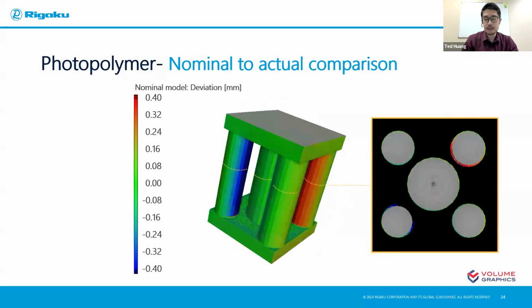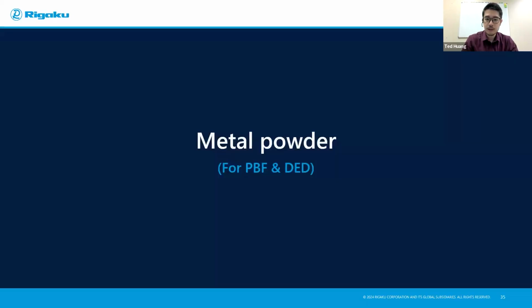So in this case, I learned about it because I did a nominal to actual comparison of the actual product I just made compared to the design. On the right, you can see it's a 2D way to give you more idea if you feel like the 3D model is still not as intuitive or not easy to show. You have full access to these kinds of data.